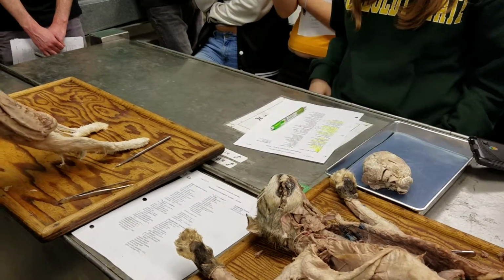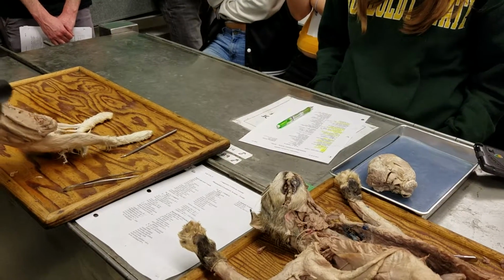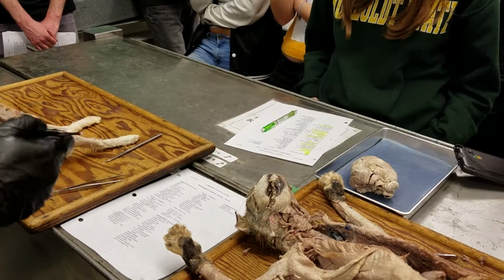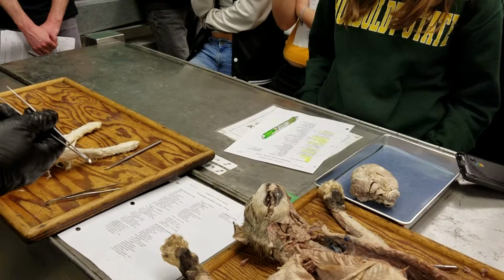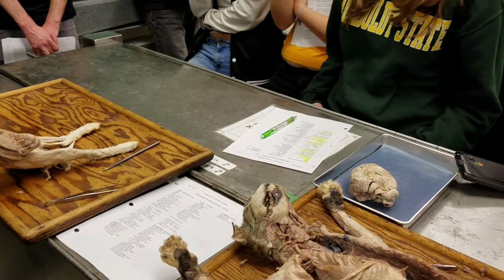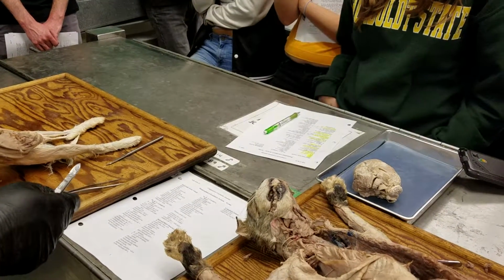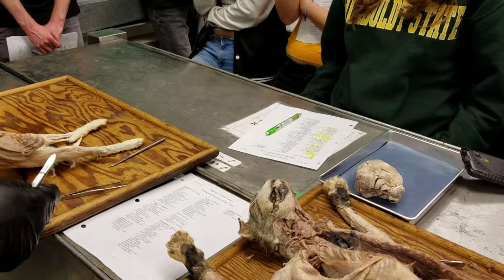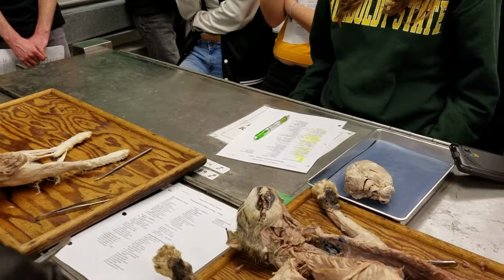The common carotids, I should probably say, run all the way up towards the head, and the branching into internal and external carotids occurs very far up. And so I didn't ask you to look for it because it's hard to find that branching. Is that in all mammals too? Like bears and stuff will also have it in the head region? Yep. Yeah, in the neck, it's just common carotid. Okay.